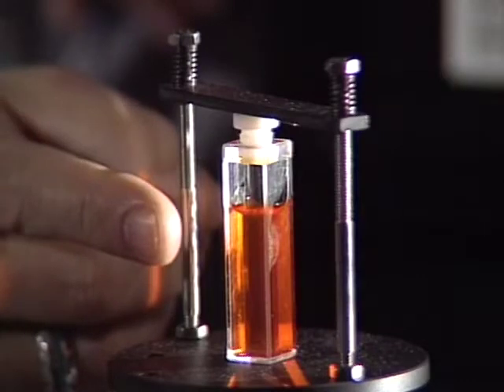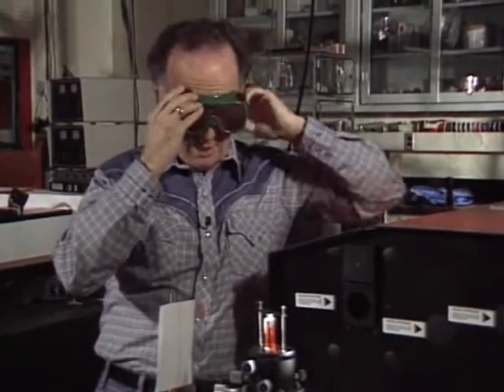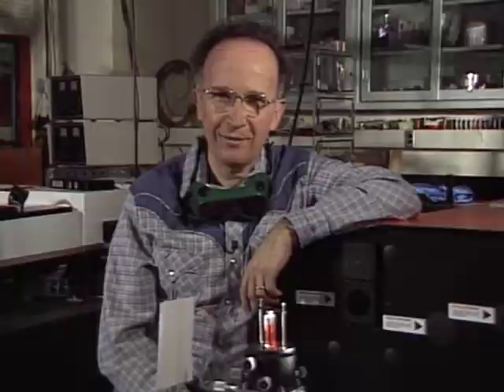Here is a molecule in solution. Let's turn off the lights and turn on the laser beam. What you see is light of a certain color coming out from the laser into the sample and then coming out after passing through the sample a different color. These imprints of a molecule on electromagnetic radiation, interpreted by us, are the signals from within which tell us what it is that we have.